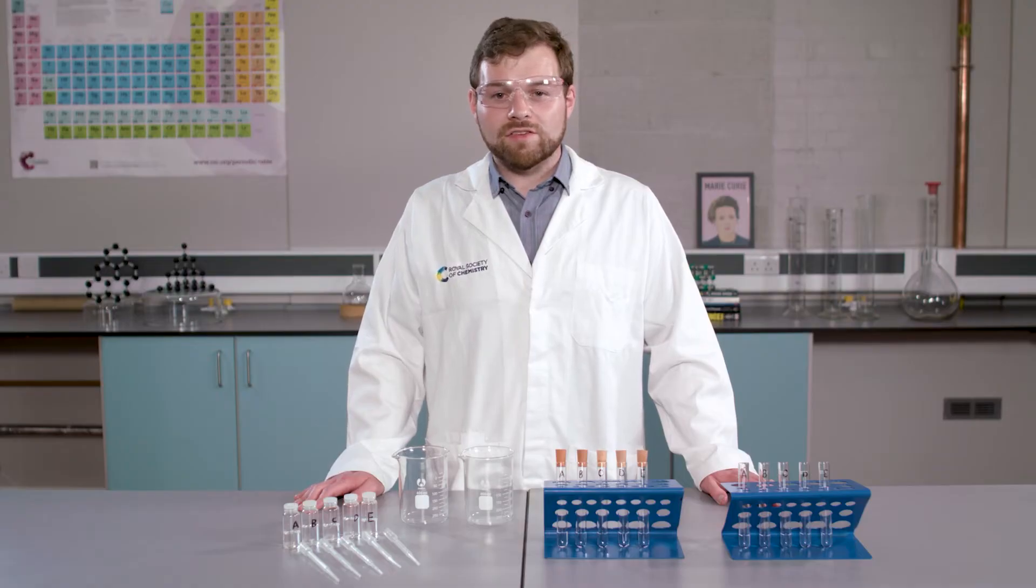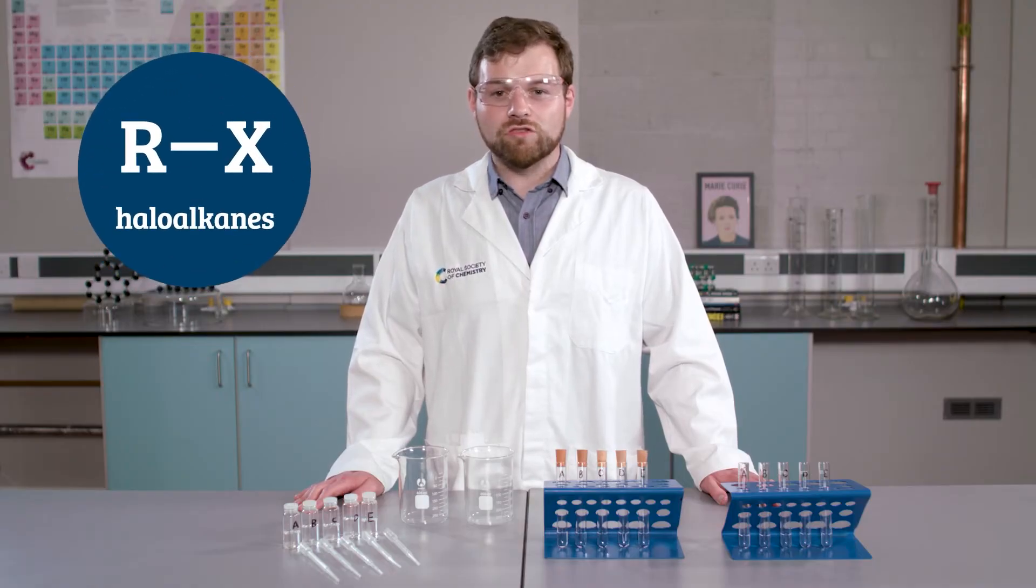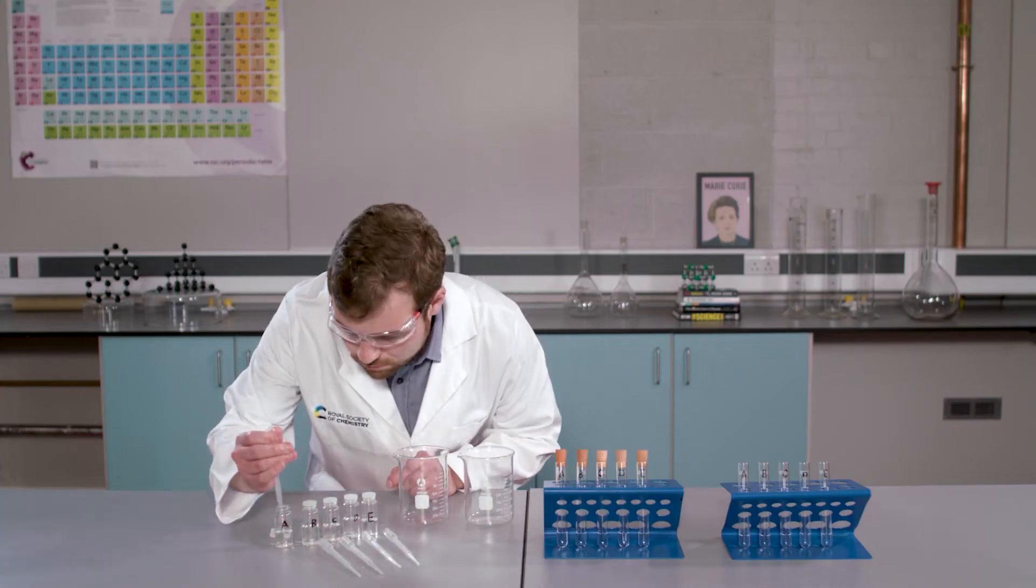Next, I am going to carry out a test to identify the haloalkane functional group. Again, I expect to see only one positive result from our samples, A to E. Let's find out what happens. This test takes part in two steps.